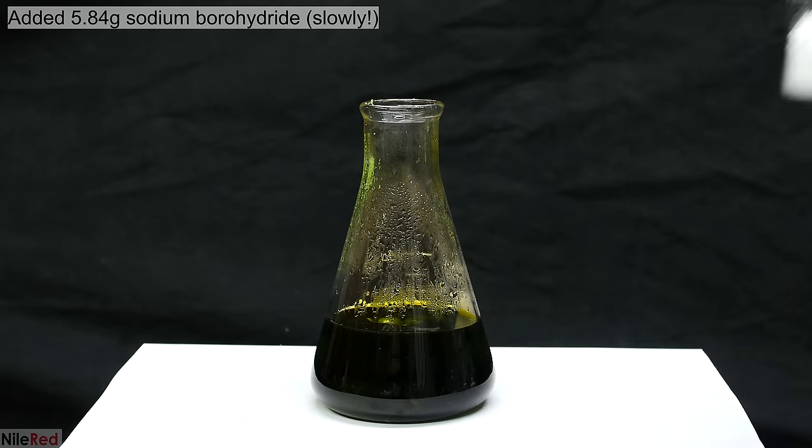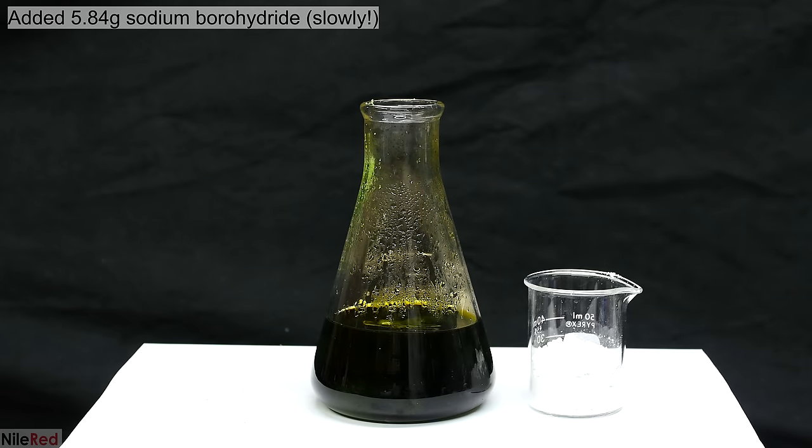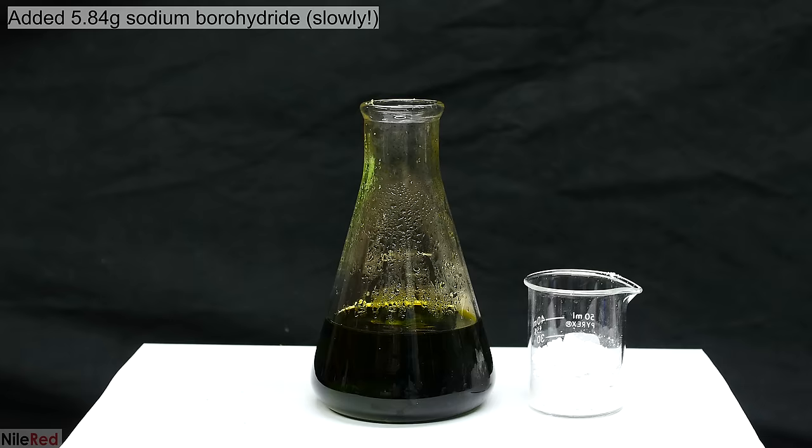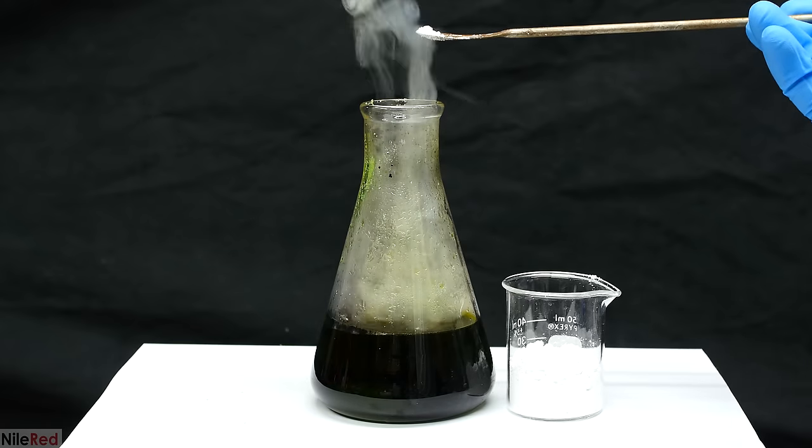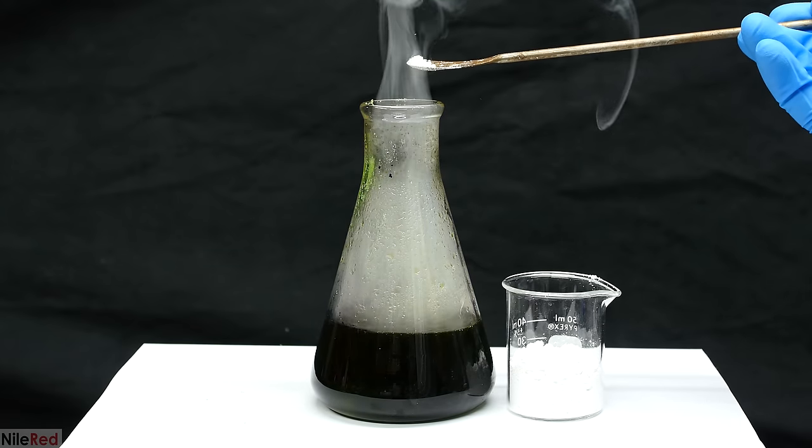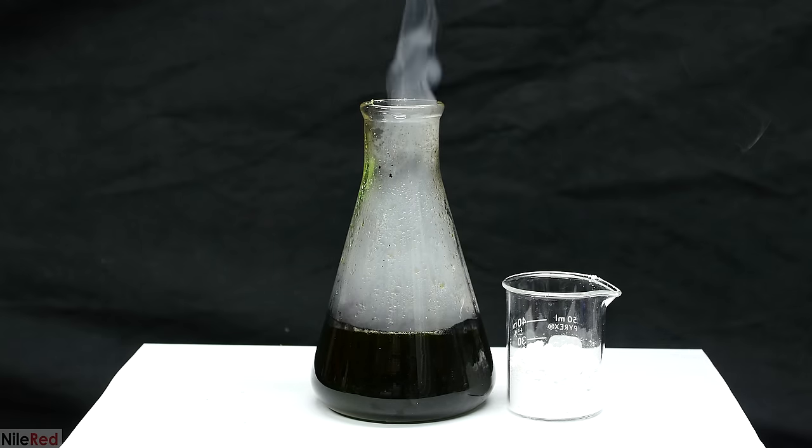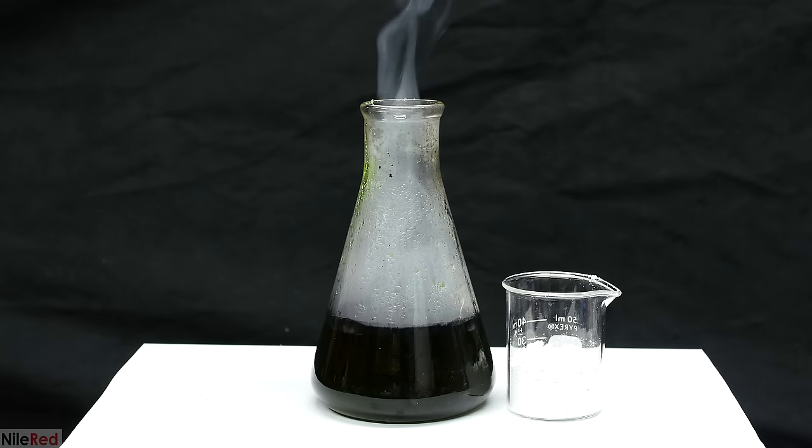I weighed out 5.84 grams of sodium borohydride, and I started to add it in small portions. It's really important to add it slowly because the reaction is quite vigorous. Also, it produces a lot of hydrogen gas, so it's important to do this in a well-ventilated area.